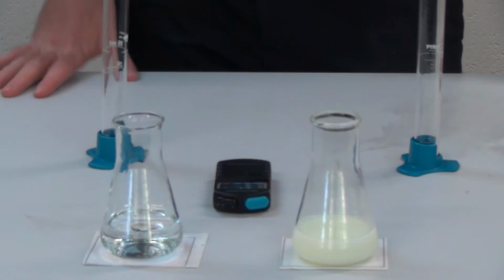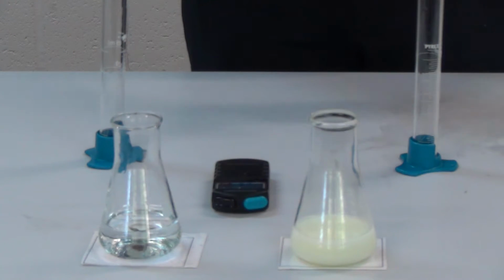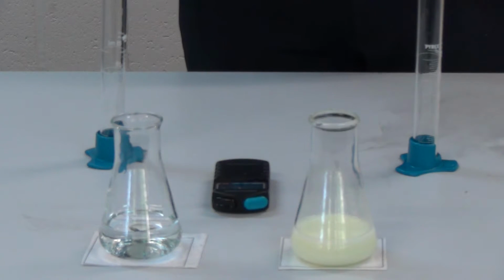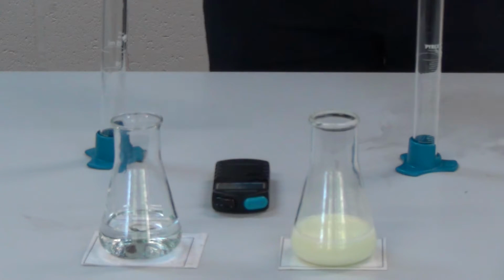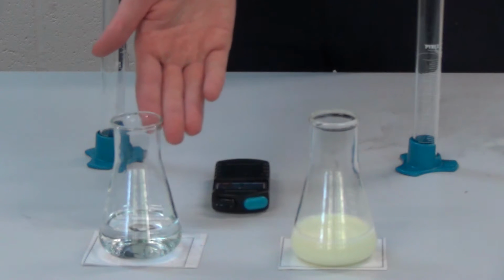Now, if you were to do this practical, you would not do them both at the same time. There'd be two of you, you'd be doing one, then the next one, then the next one, then the next one. What you'd want is to make sure that you're keeping a really careful eye on that cross, making sure you're trying to get really precise and consistent with the exact time that you can't see it anymore. And then because you're doing it one at a time, it means you're getting a much better time for each one. Now, you can see how quickly that one went, and this one is still going and still going.